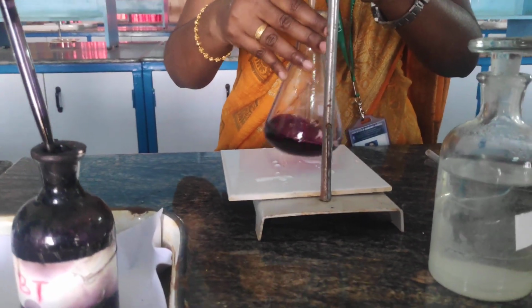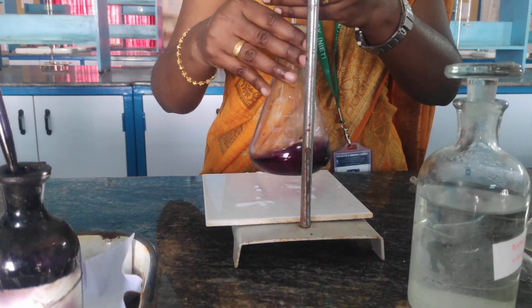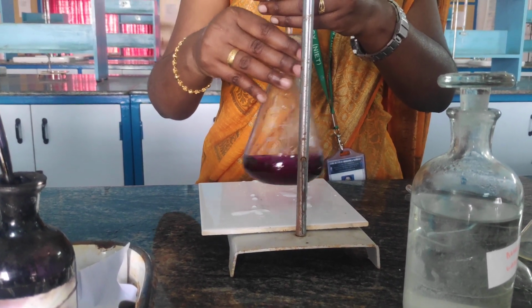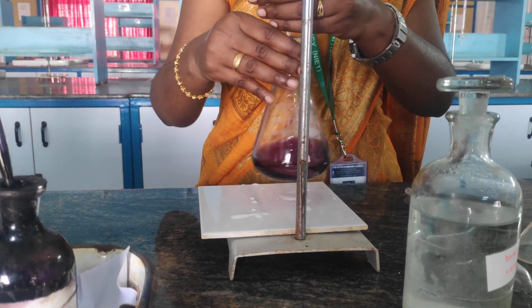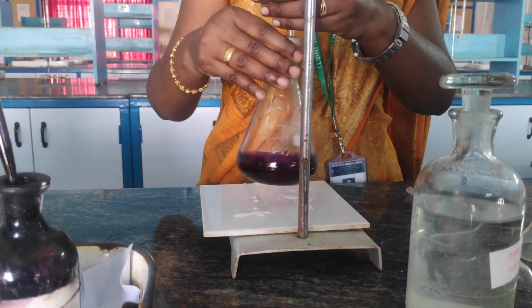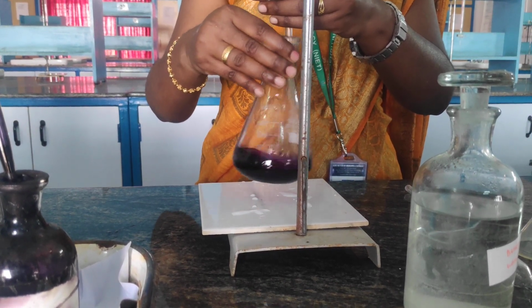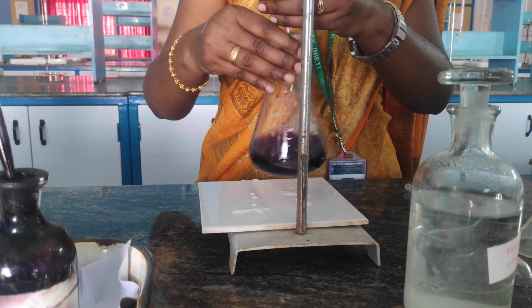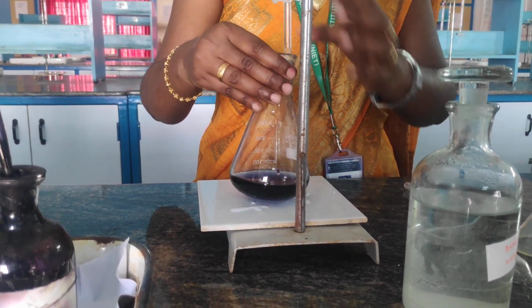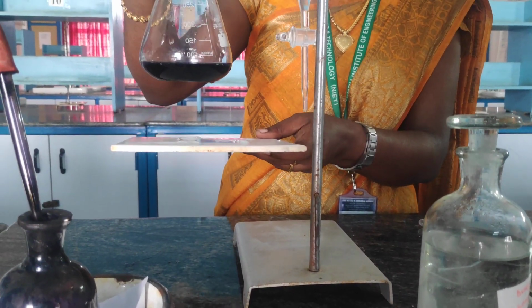So when the titration is carried out, again this EDTA reacts with the tap water, and it forms a complex inside the solution where all the hardness has been removed and it is left out with EBT. So we all know EBT is steel blue color. So this is the color of the solution.